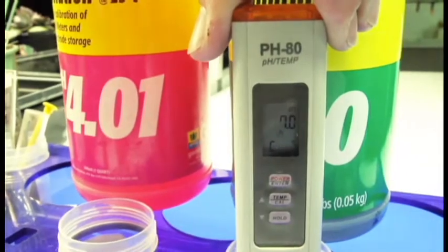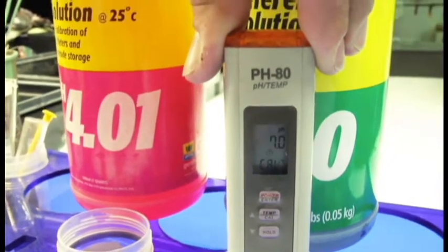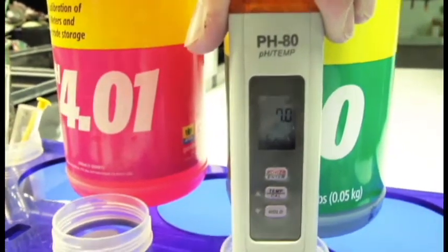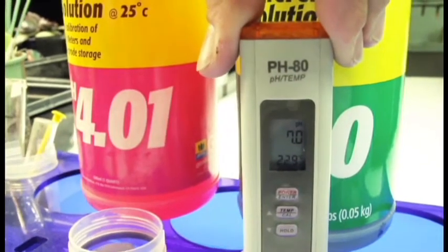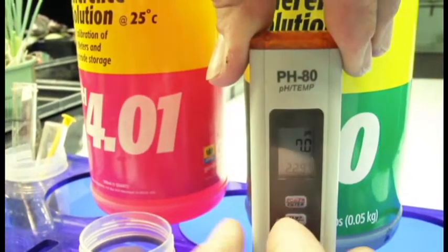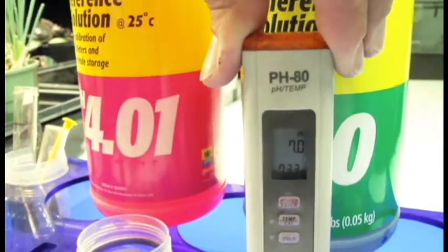Now it's calibrating and it's going to say the word end to tell me it's done. I wait until I see the temperature before I remove it from the solution. Before I remove it, I always hit that center button so it goes back to Fahrenheit.